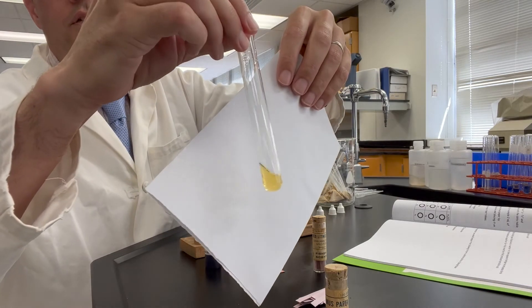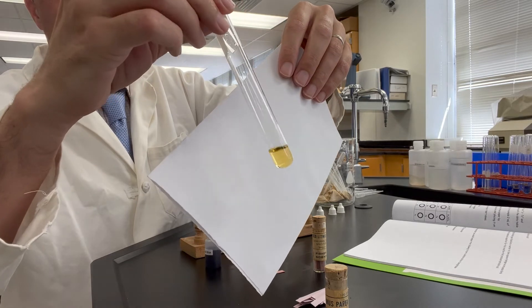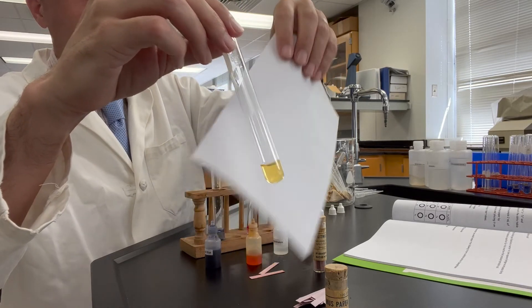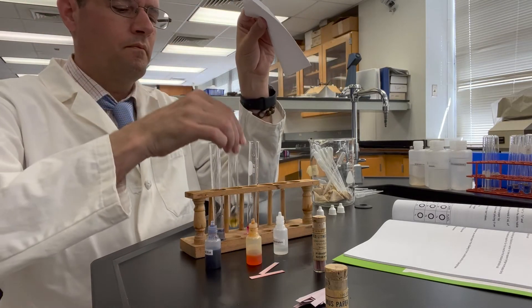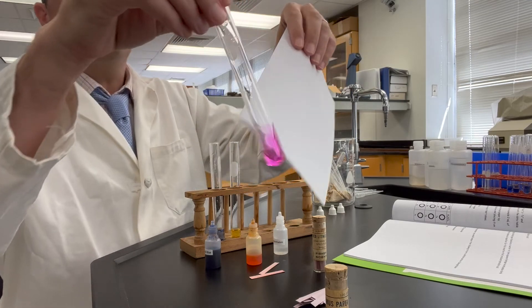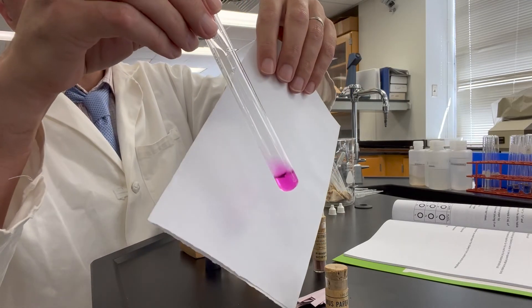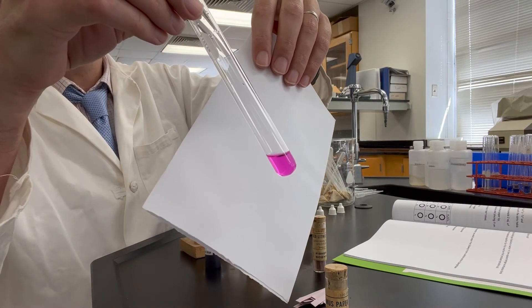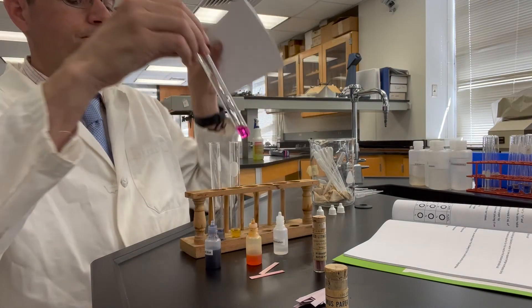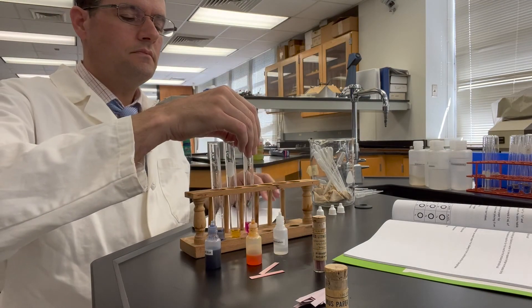Methyl orange with 0.1 molar sodium carbonate, and phenolphthalein with 0.1 molar sodium carbonate.